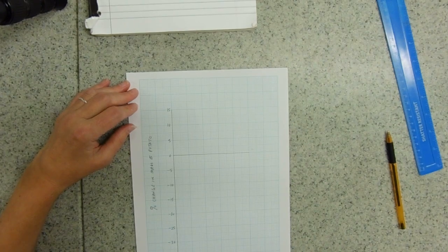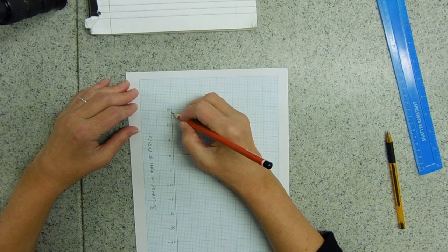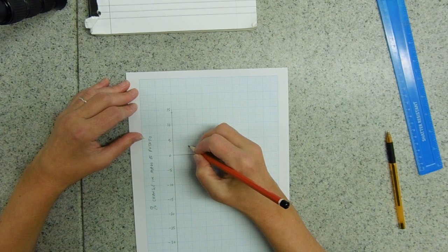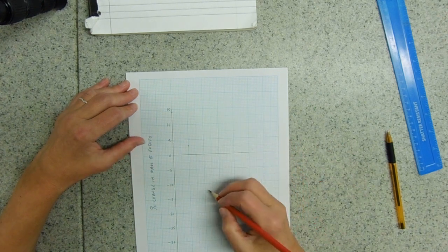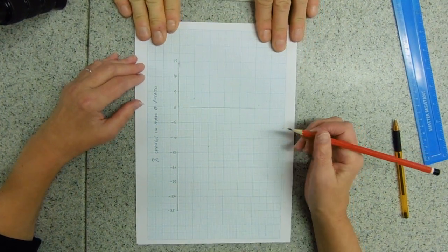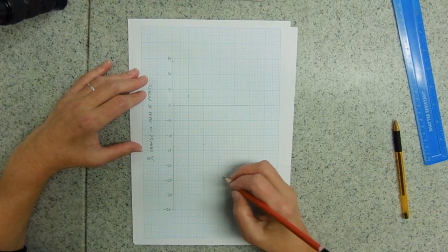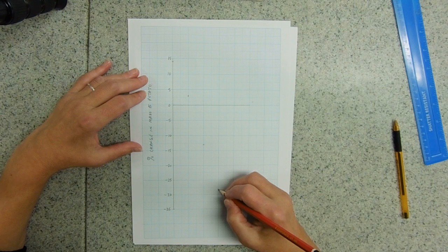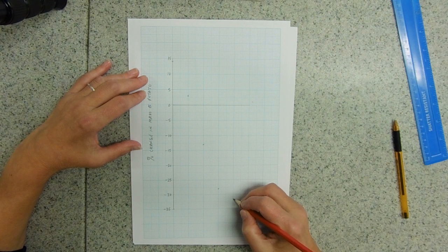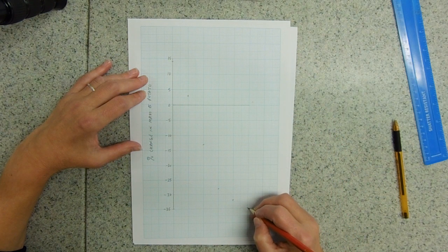My first value is 14.4 — I'm going to do it to the nearest whole number, so 14 will be there. At 0.2 it'll be 3. At 0.4 I've got minus 12.8, so I'm going to call that minus 13. Then minus 27.6, which I'm going to call minus 28. Then minus 32.3, which I'm going to call 32. And finally minus 34.9, I'm going to call that 35 — filling the scale up beautifully.